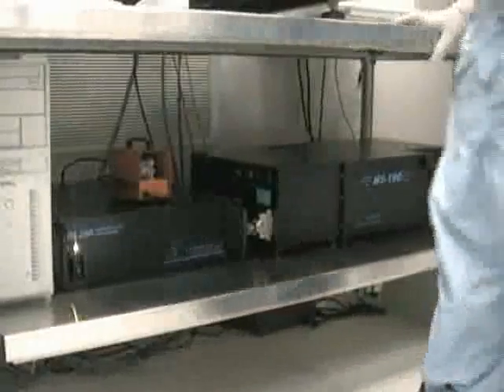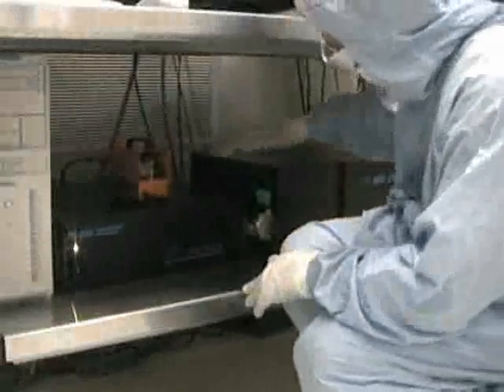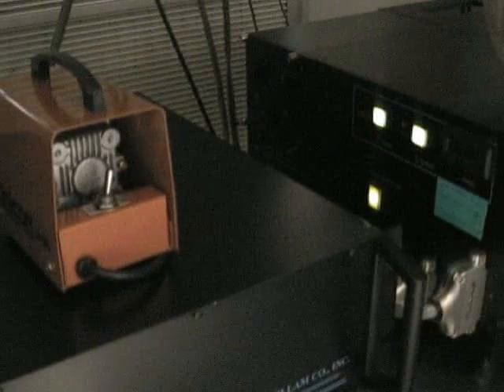You'll first need to make sure that the monochromator power is on. Then turn on the lamp power and lamp ignition switches, which are located on the side of the monochromator. Also, make sure to turn the vacuum pump on.